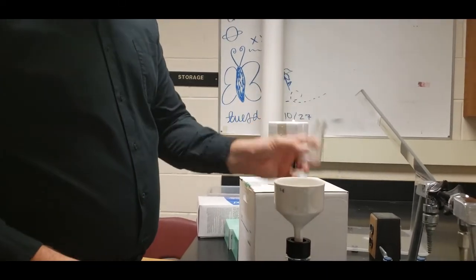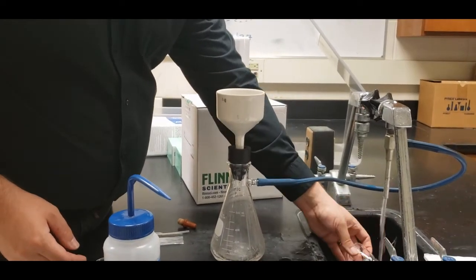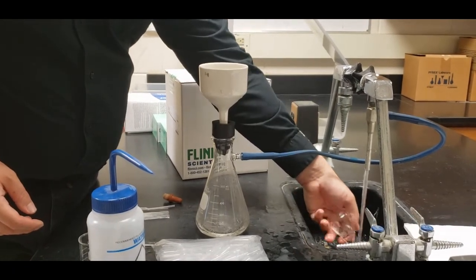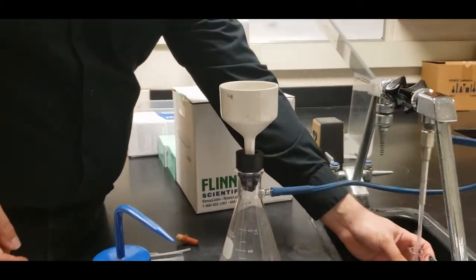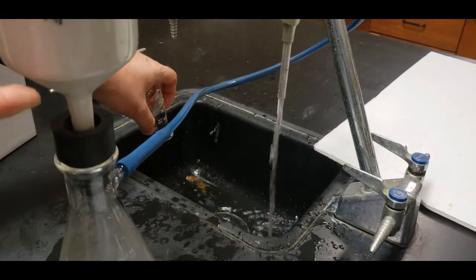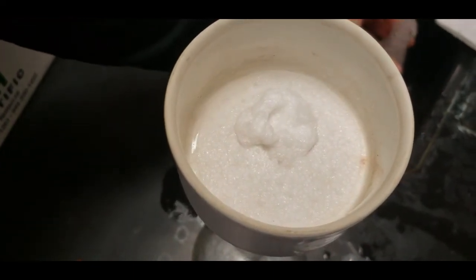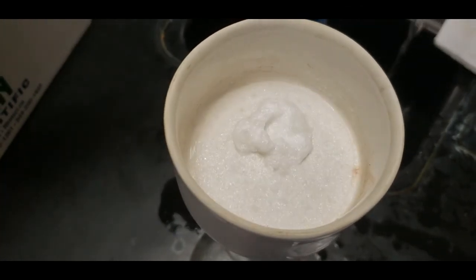And then this leftover that is still in here, unfortunately, is going to have to go for our waste. Okay? Now as you notice, we're going to continue to have the water get pulled out of here, right on top, until we have nice dry crystals. The product that we have here should be aspirin, and we will be able to test it shortly.